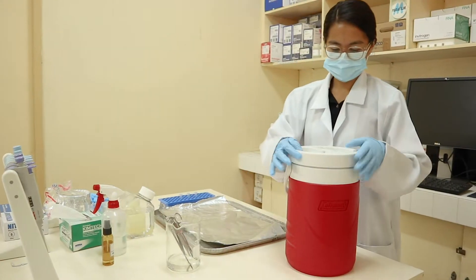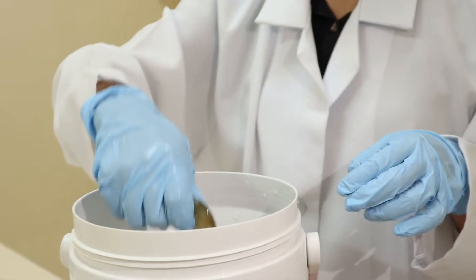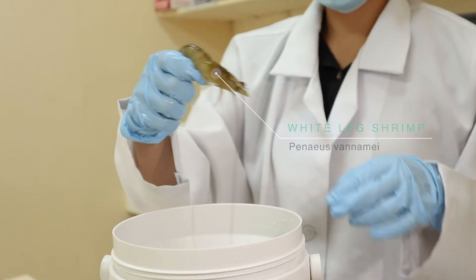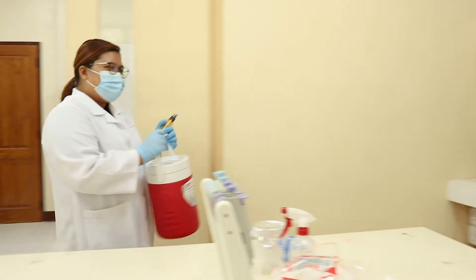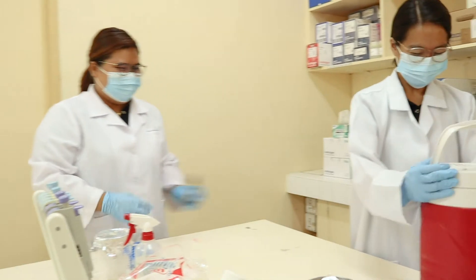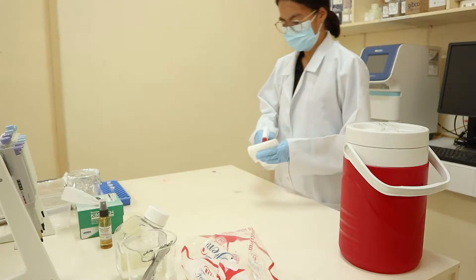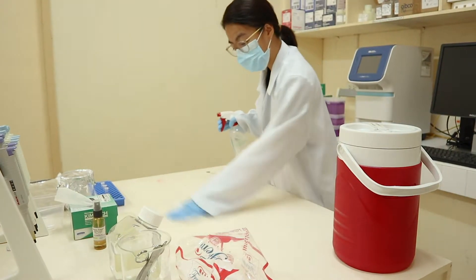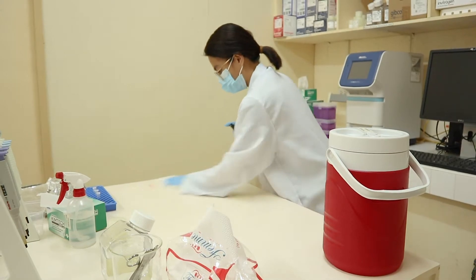For this gene expression analysis study, samples will be taken from the hepatopancreas of white-legged shrimp, Penaeus vannamei. Prior to extraction, all materials and surfaces are disinfected to remove RNases that are present in the environment.